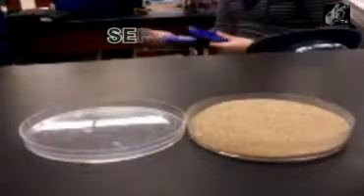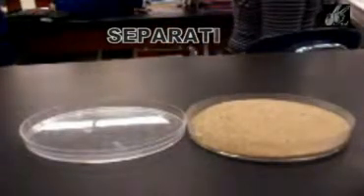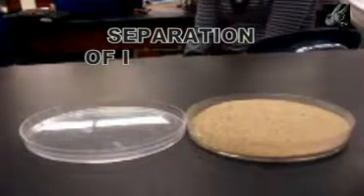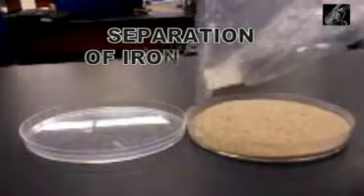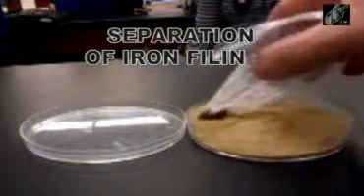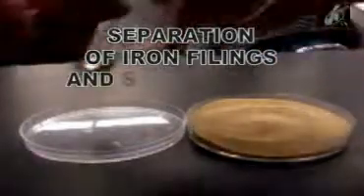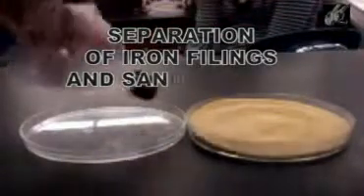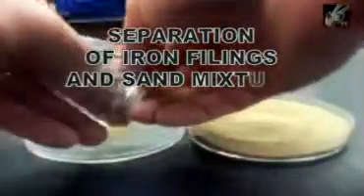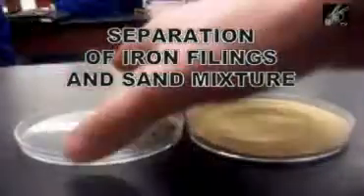Here we have a mixture of sand and iron, and to get this mixture unmixed, one thing we can take advantage of is the fact that iron is magnetic. So I have here a magnet inside a plastic bag, and if I put that in there, we can very quickly pull the iron out of the mixture. Then all we have to do is remove our magnet from the bag or invert our bag to get the iron fully separated.